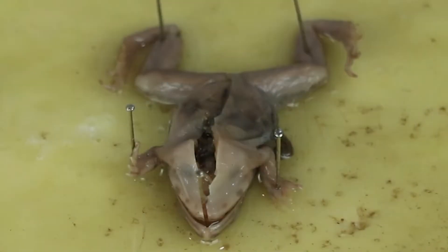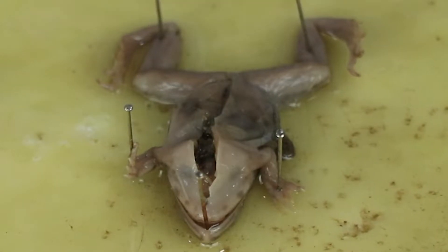Frog belongs to class Amphibia and it is a vertebrate, so it is dissected ventrally.